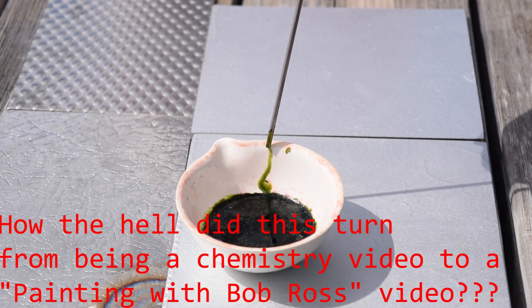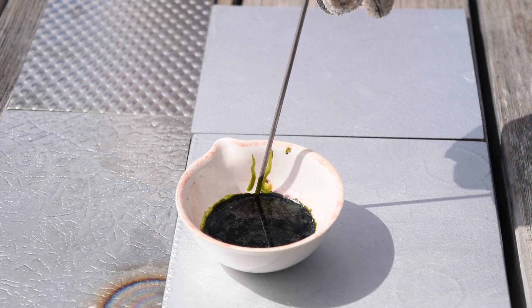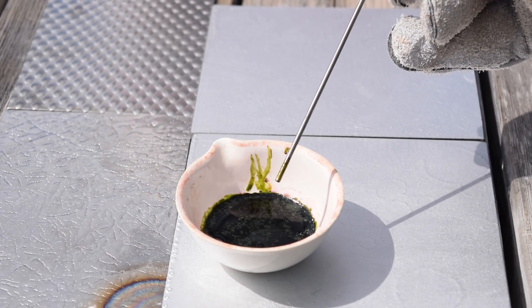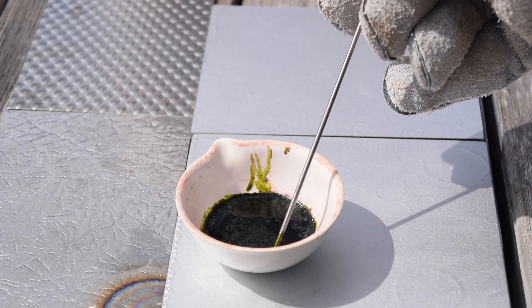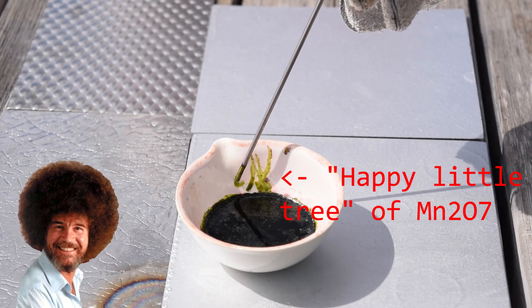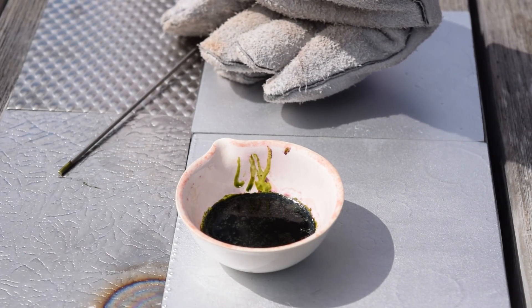I'm going to streak a little bit up on the side, and you can see that nice green color of manganese heptoxide in contact with the sulfuric acid. You might be able to see some wisps — I believe it hydrolyzes in contact with water, and it'll just be some sort of acid vapor. You can see that nice green color.